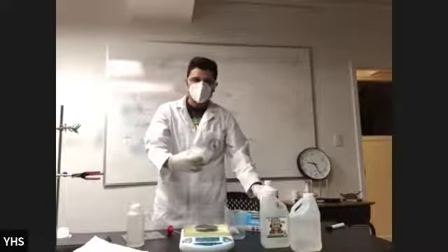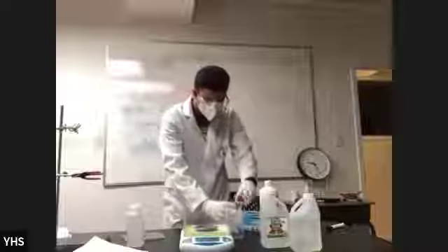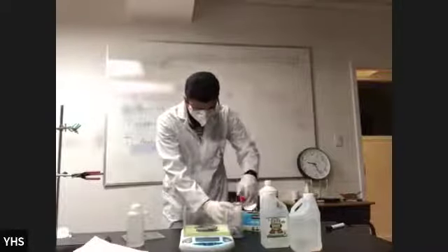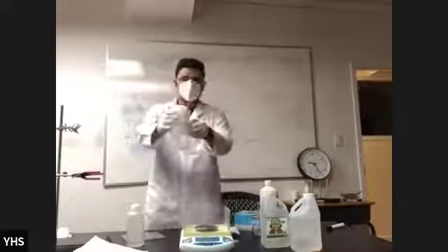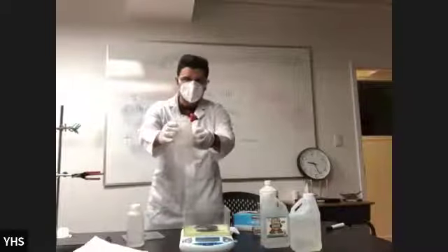There is foam coming out, right? So I gotta be careful. All right, so let's do it this way instead. Okay, I got a bunch of foam coming out. Right? Can you see it? Yes.